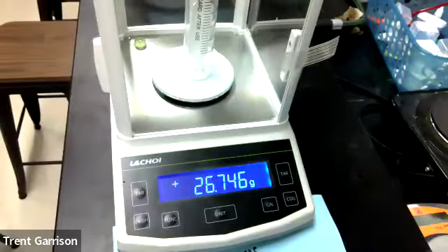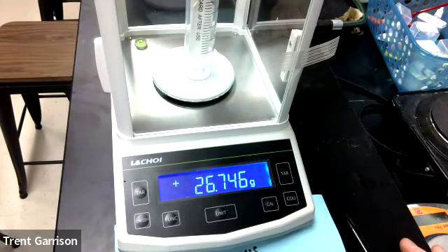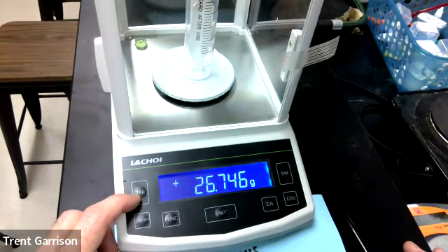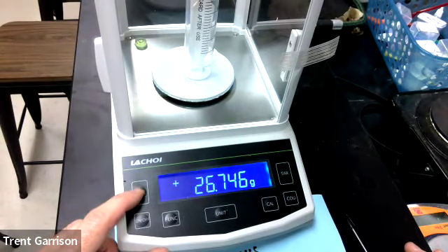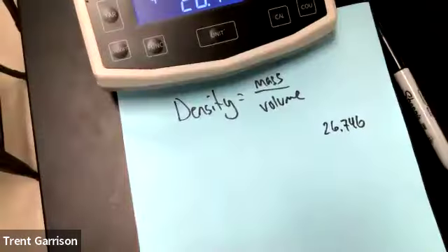Put the cap on, move the opening on top, and place the syringe in, close the opening, and then get your measurement. Now, what you can do here is you could zero this out. You could push the tare button, although it says tar. They couldn't put that E on there. So you could push the tare button if you wish. But my guess is that this one fluctuates, and the weight of gas is not very much. So it's probably going to be better if you just write down the value.